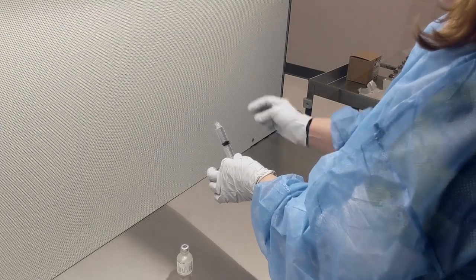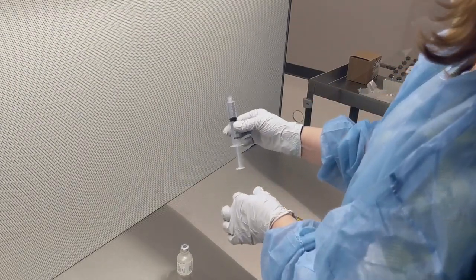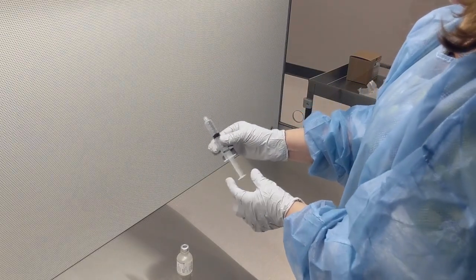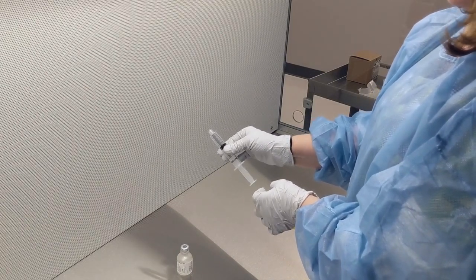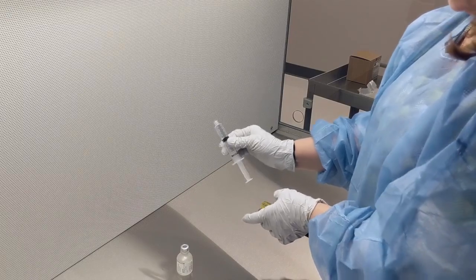And then if this were to go to the floor, we'd put a little cap on here and label it up. For purposes of practice, we are going to put this whole syringe into the trash. It does not go in the sharps container.